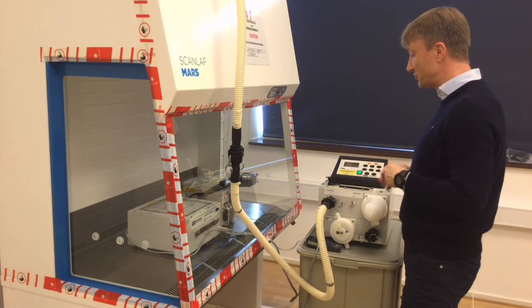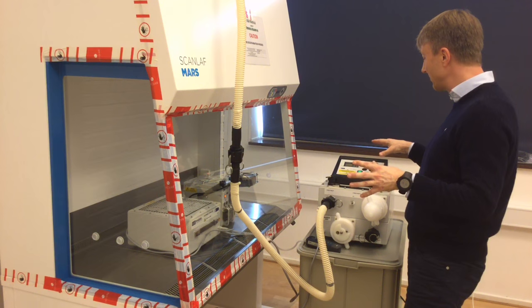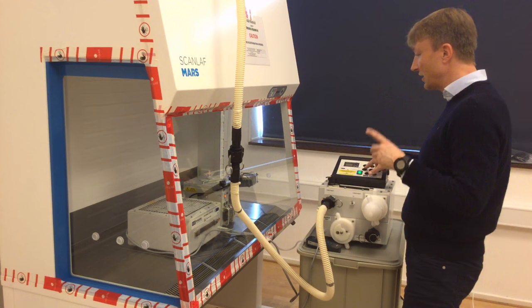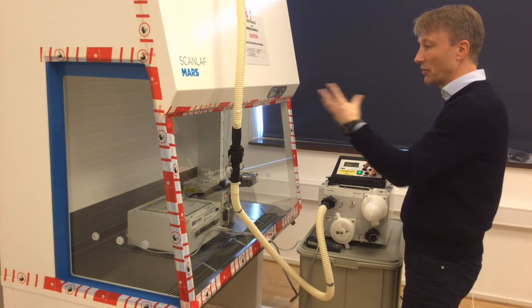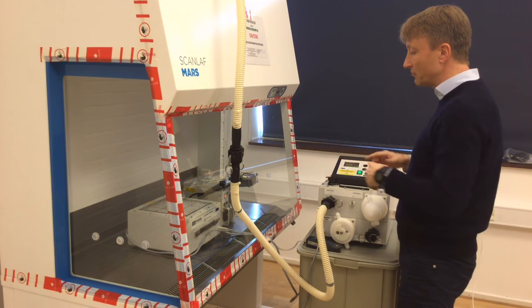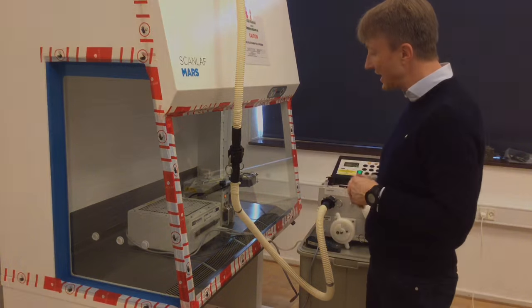We are now ready to start the process and I have validated programs here at my control board. I push in for the type of cycle I want to run with this and I push start and then we see that the process will power up and start.